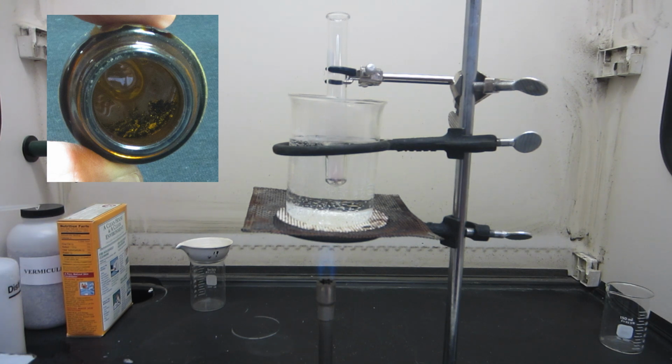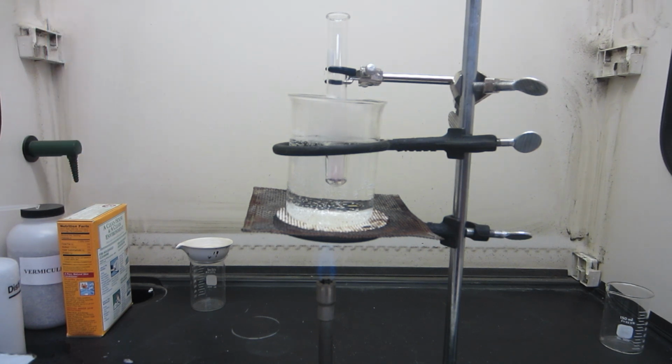And all I'm doing is I'm placing one of those small crystals in the test tube there. And I think you can see that there's a hot water bath there on the ring stand. Bunsen burners providing the heat. And already you start seeing a bit of a purple gas in that test tube there.